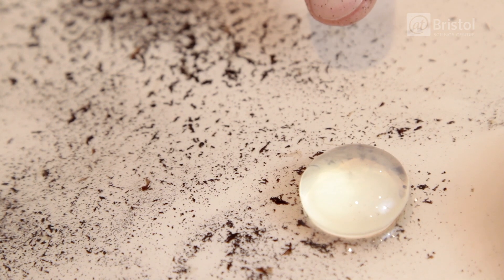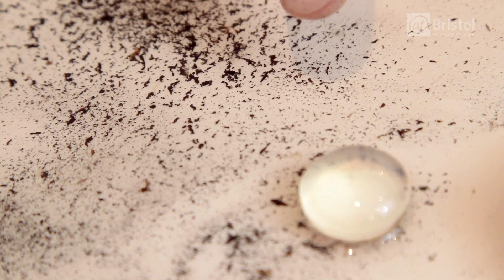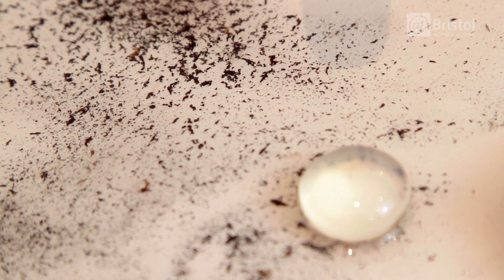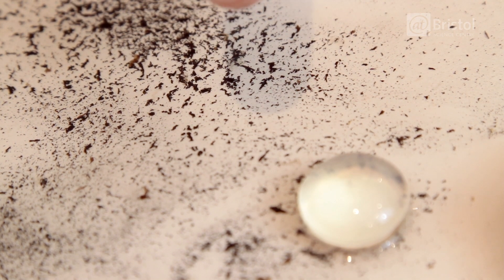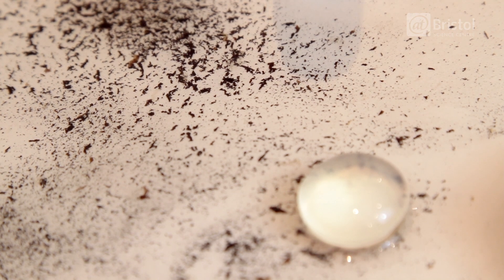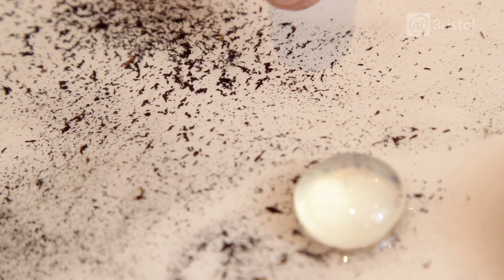And these help to keep the round shape of the eye. Now these black things here are the retina cells. These are a layer of light-sensitive cells at the back of the eye. The retina detects the image focused by the cornea and the lens, and the retina is then connected to the brain via the optic nerve. But after you have frozen and defrosted the eye, these cells become detached.